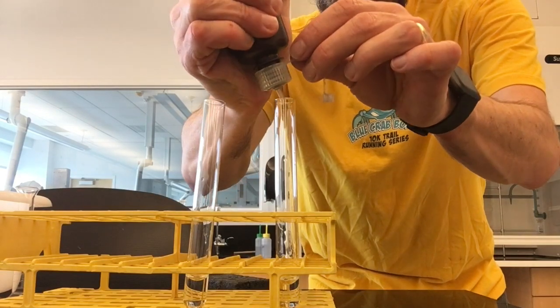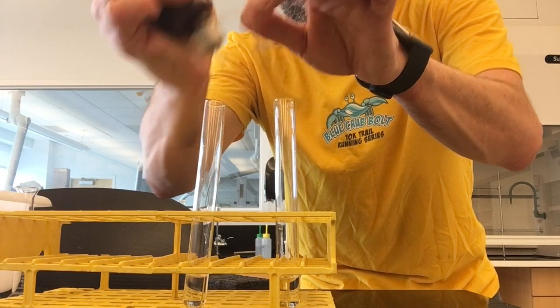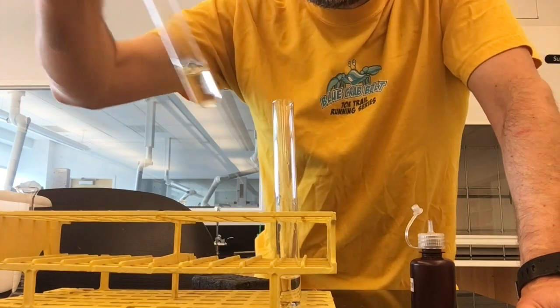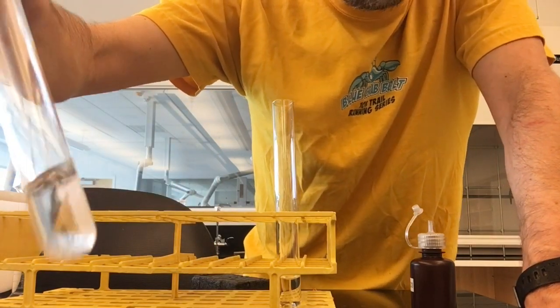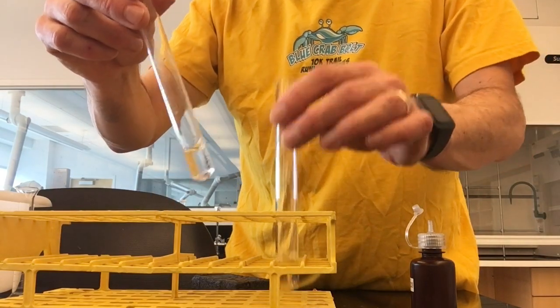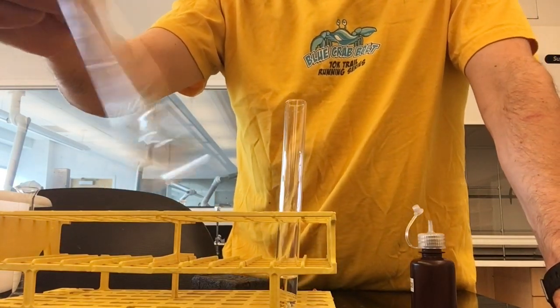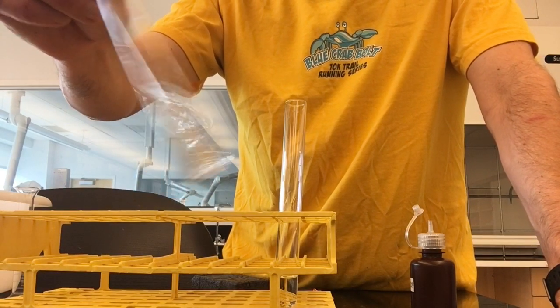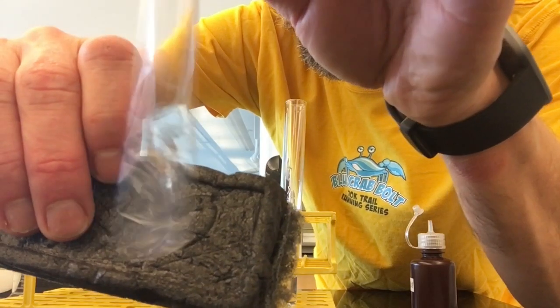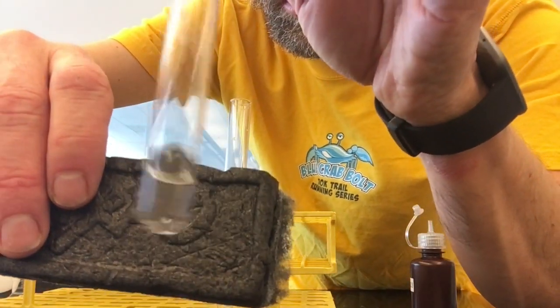Adding five drops to the bromoethane and then five drops to the 2-bromopropane. After shaking them up, you can see the bromoethane hasn't done anything yet and the 2-bromopropane hasn't done anything yet if you look closely. But if we shake them for a minute, we'll notice a difference between the two — after about a minute, the 2-bromopropane starts getting cloudy. You can even see it happening a little bit right now. It's hard to observe with a white background, but with a darker background, you can see it's starting to get cloudy, whereas the bromoethane is still completely clear.